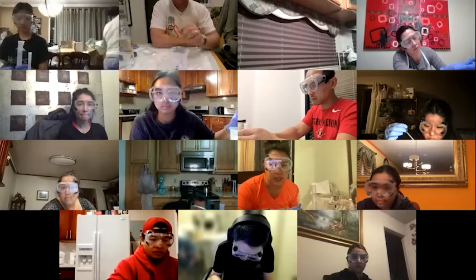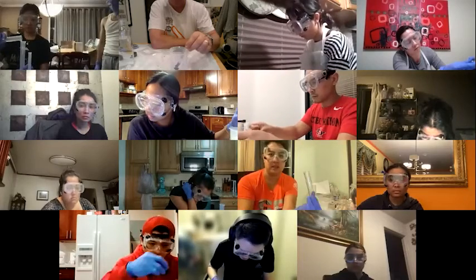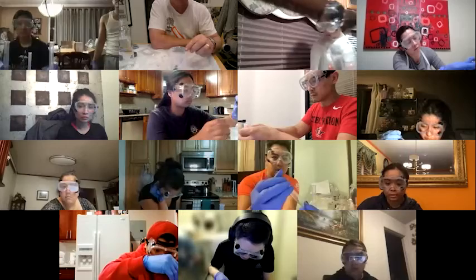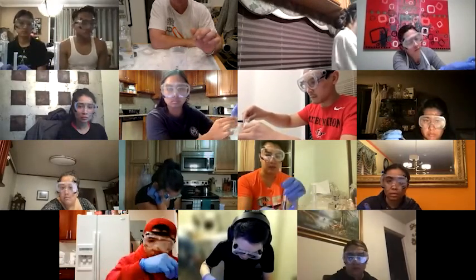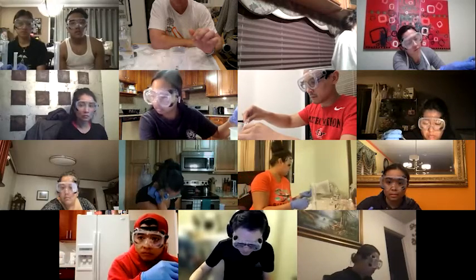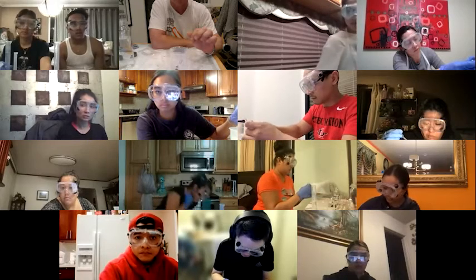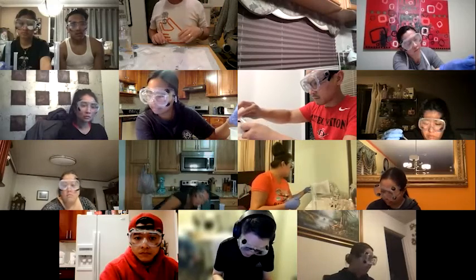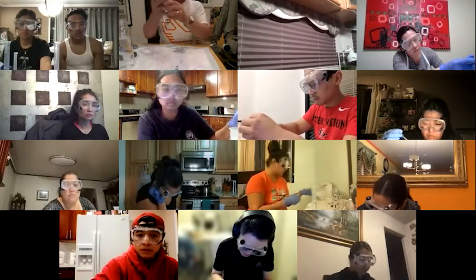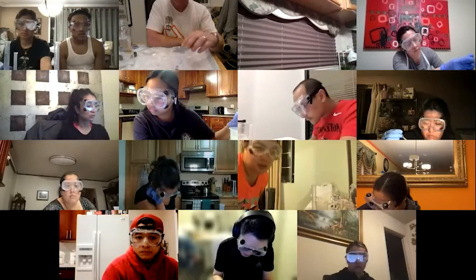Can I see how your stopper fit in? Did it plug from the very top? I just want to make sure I have the correct one, because it's the same ones that we use. Not much of it should poke in. But you see how mine's going all the way in? Oh yeah, that's the wrong tube, I think. Is that plastic or glass? I think she's using the plastic one. You want the black one. Look around for it. It took me a while to find it. It looked like this, wrapped up in bubble wrap. I'll be back then.